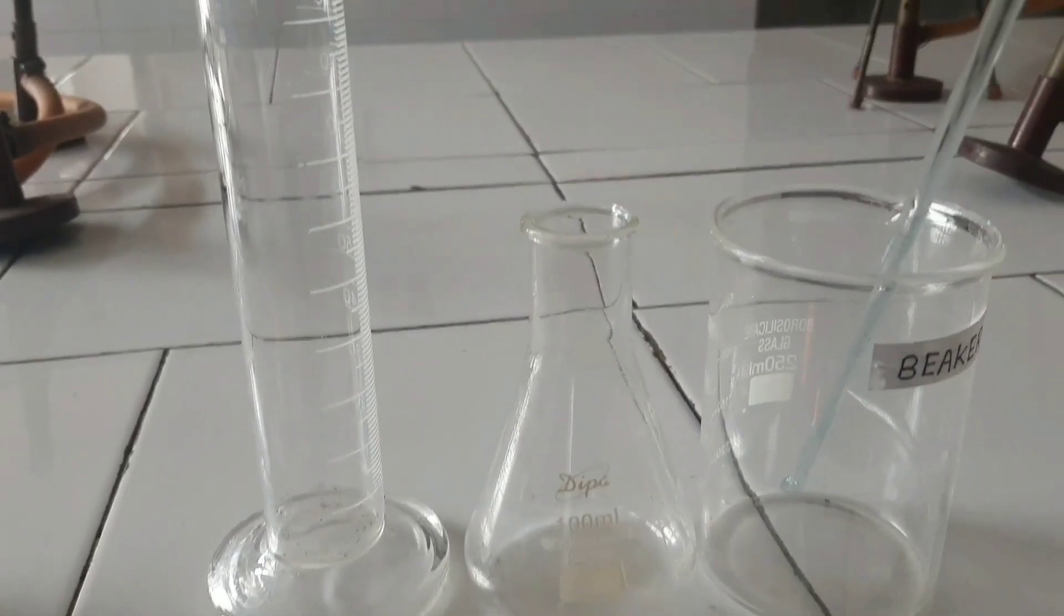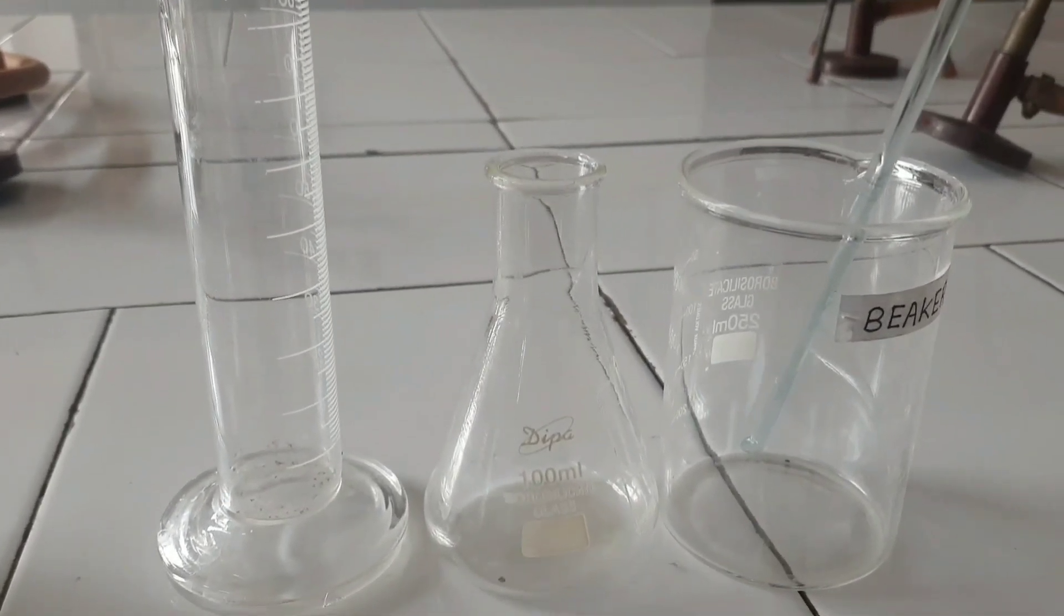Apparatus required: measuring cylinder, conical flask, beaker, and stirrer.